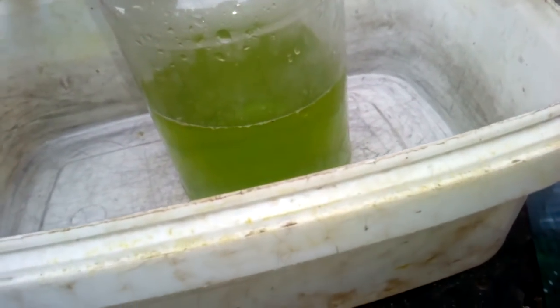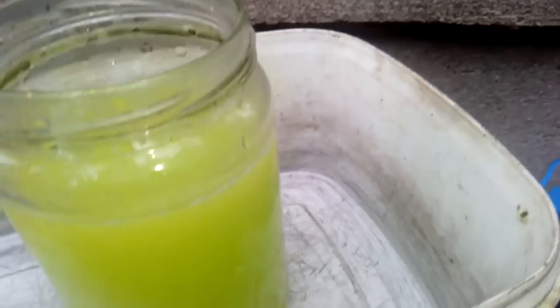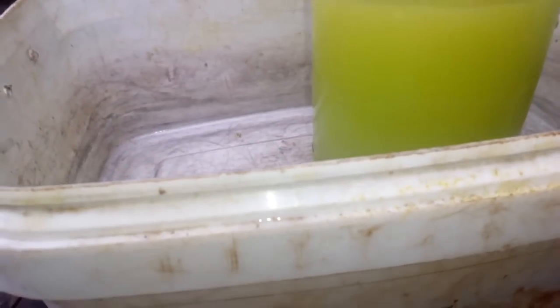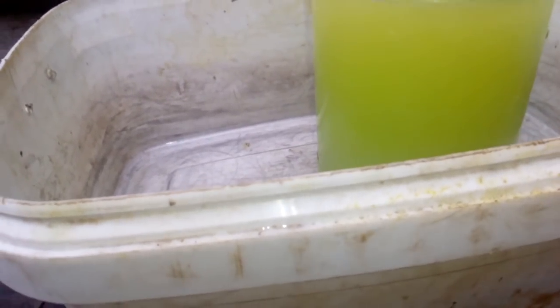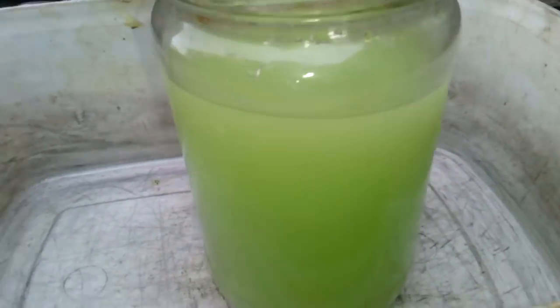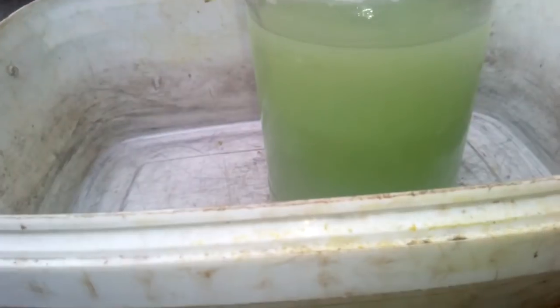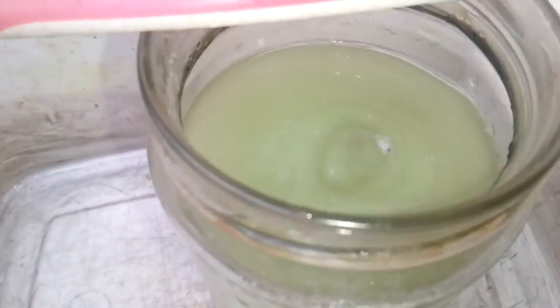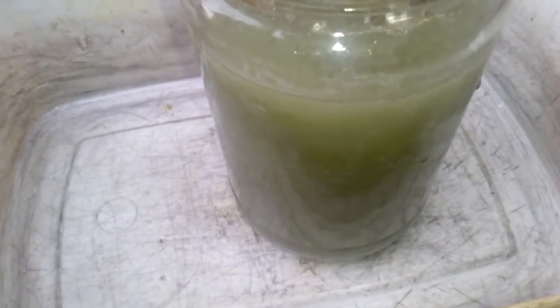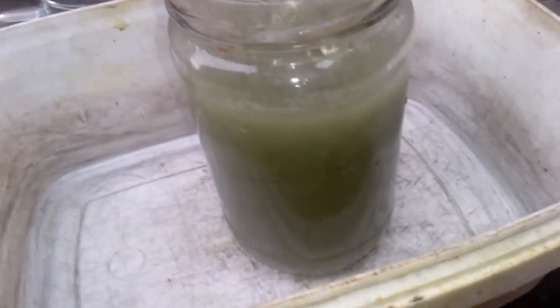Let's drop some gold from the contact. Looking good. Looking good — a lot of silver chloride inside, but never mind.